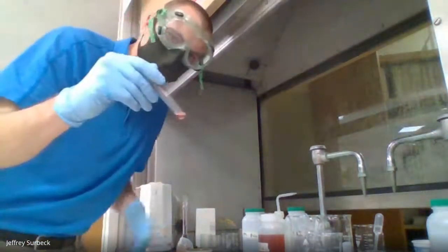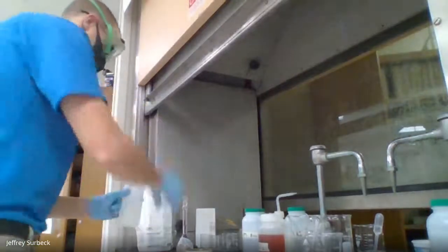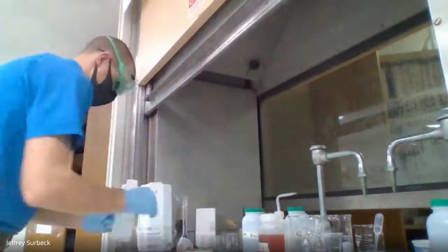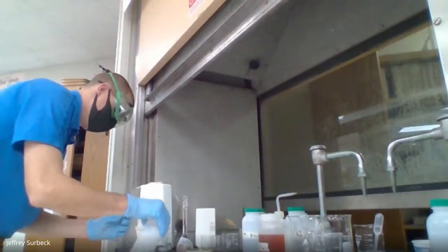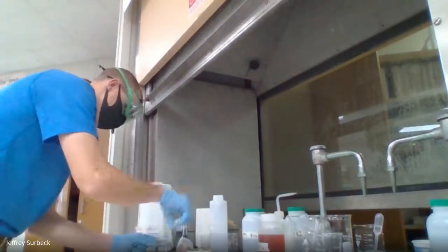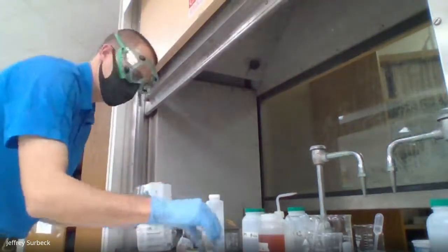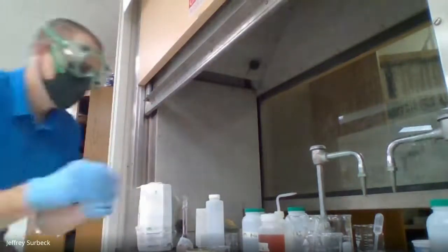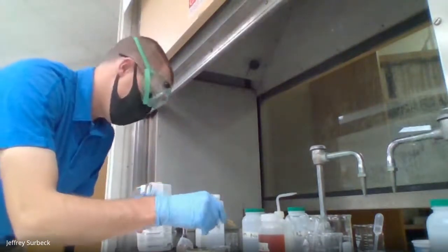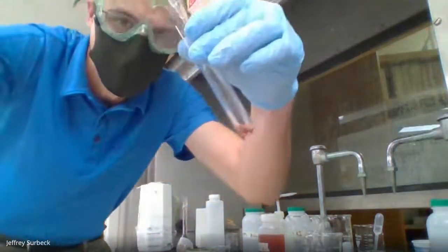So I'm going to grab my HCl, and we'll go from there. Okay, I am going to add it dropwise until we have a distinct color change.